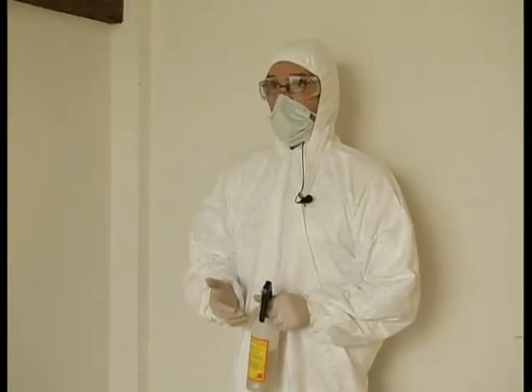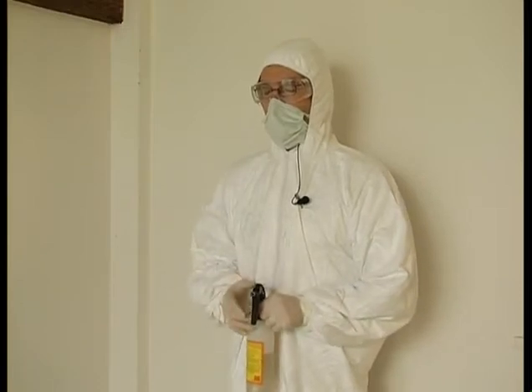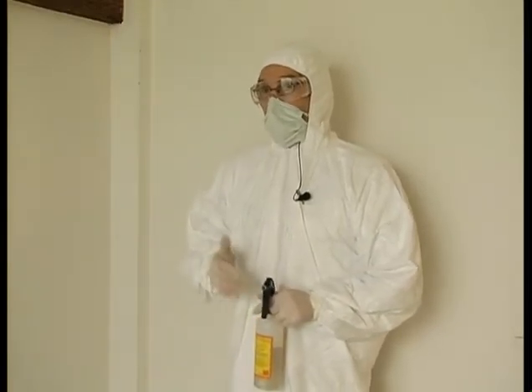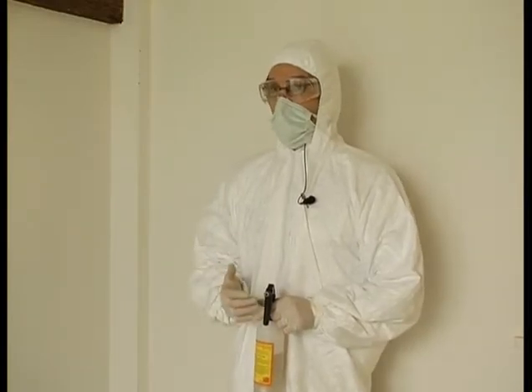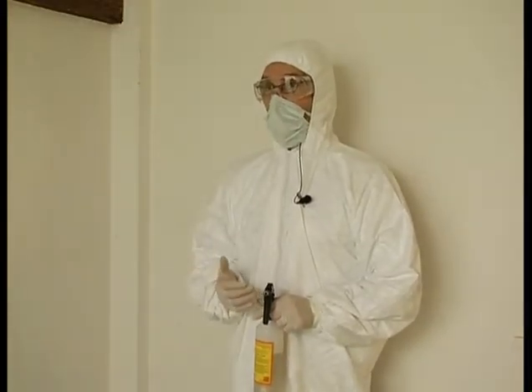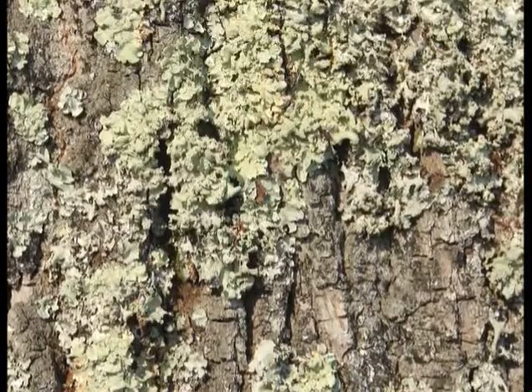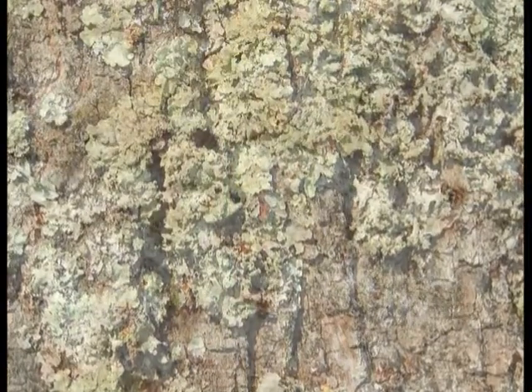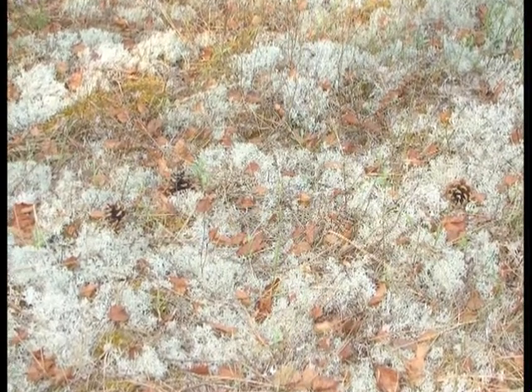More generally, what can cause a reaction with Bluestar? Metal ions. Where can they be found? They can be found in nature. For example, simple lichens will concentrate metals from pollution. So these lichens will react.